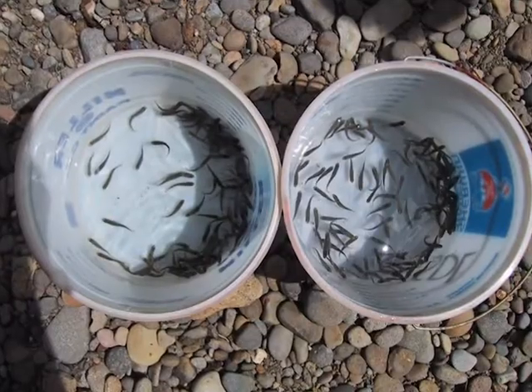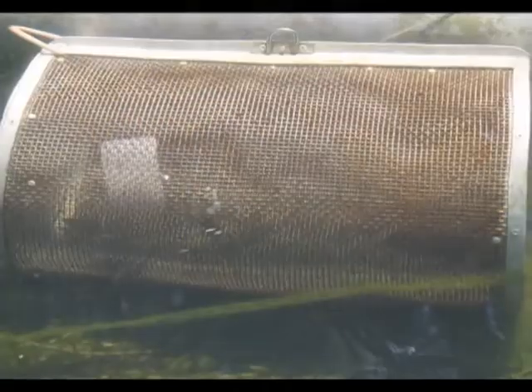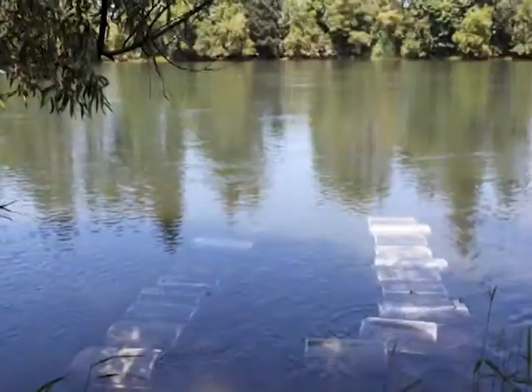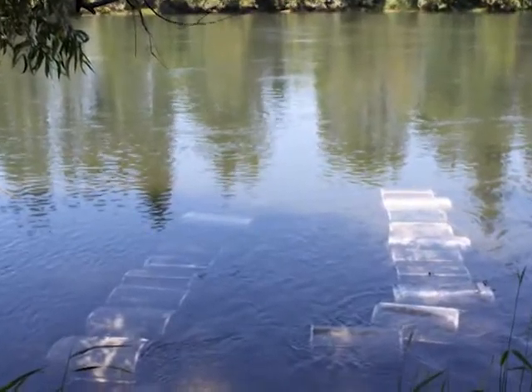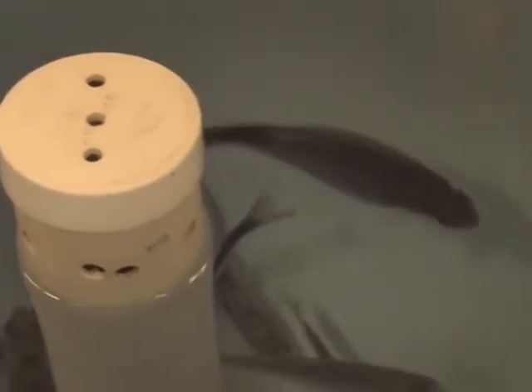These fish are obtained from hatcheries, then driven to the river and placed in cages. After 3 days, the fish are transported back to the salmon disease lab, where they are monitored for signs of disease for up to 3 months. Some of the classic signs include a swollen abdomen because of fluid buildup, a reaction to the infection. Also lethargy, the fish tend to be quite tired and sit on the bottom of the tanks. Often you may also see a blackened tail, and the fish tend to not eat as much.